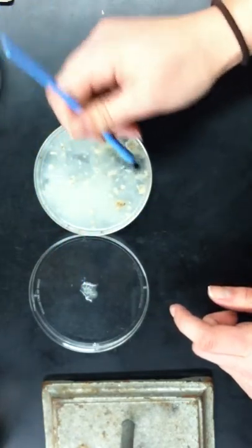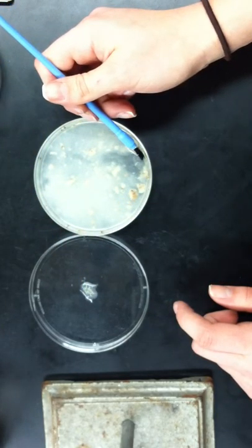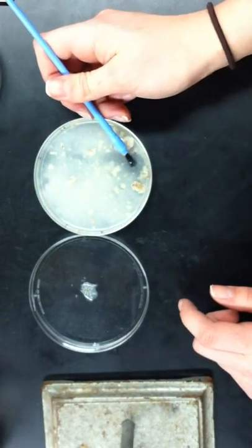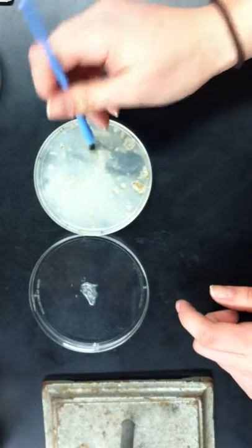So just as many as you think you'll need for the trial. Again, probably 15 to 30 average. Some vials will have more larvae than others. That's why it's important to look at the tunneling in the fecund culture, because the more tunneling you see, the more larvae that are probably present.